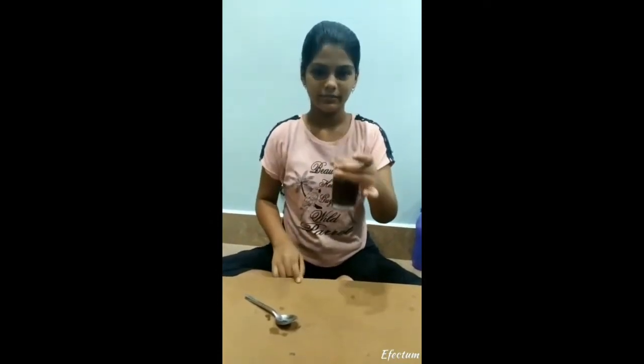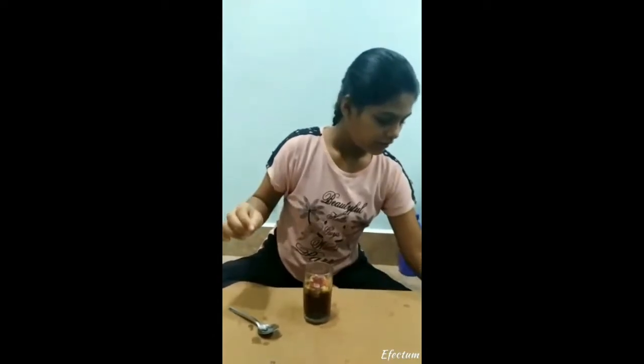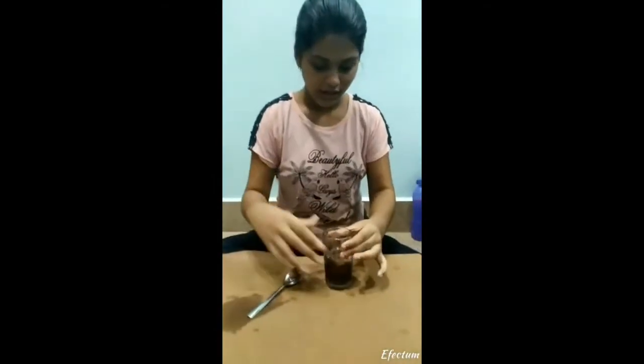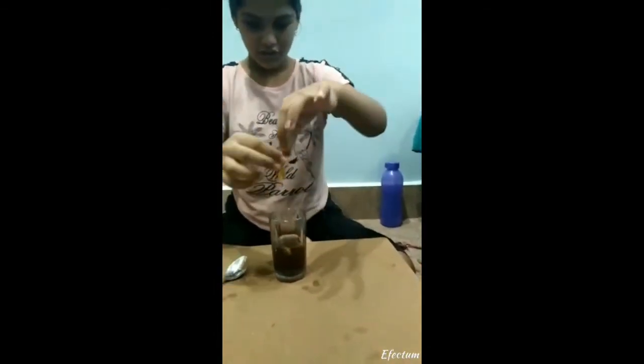We will keep it in a little while, and this is the color of the water. We keep it in a little while, but this color is completely removed. Look at this — the color of the China rose is also very different. It is pink and yellow.